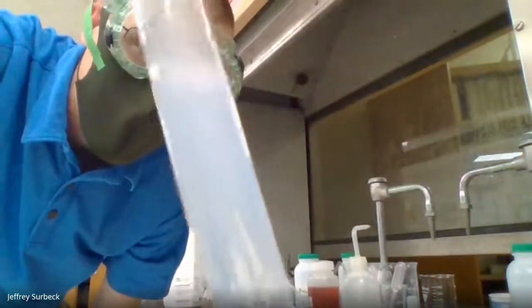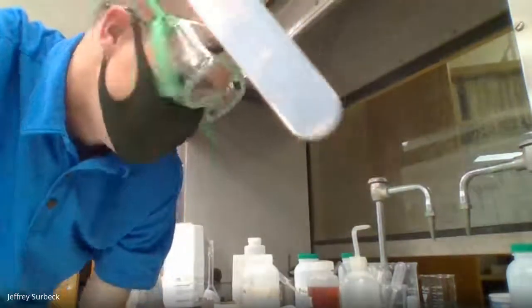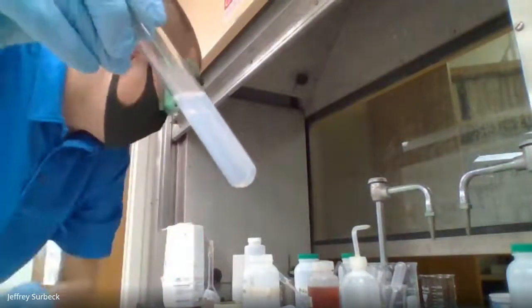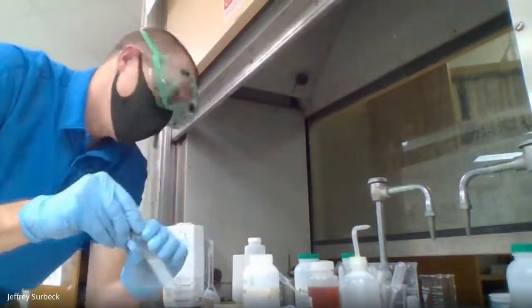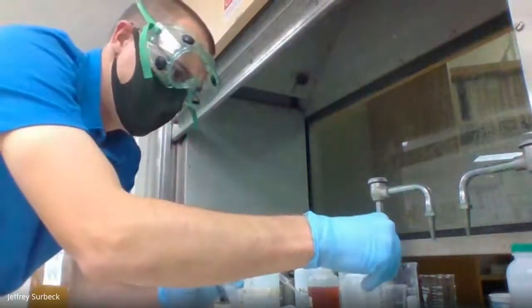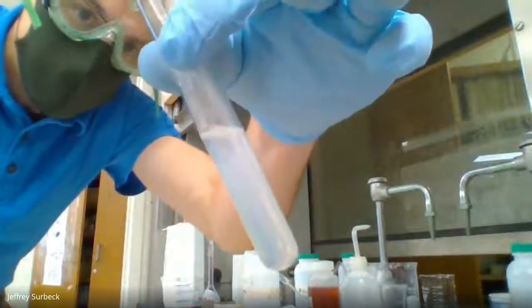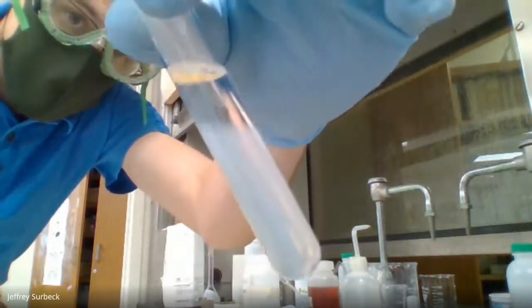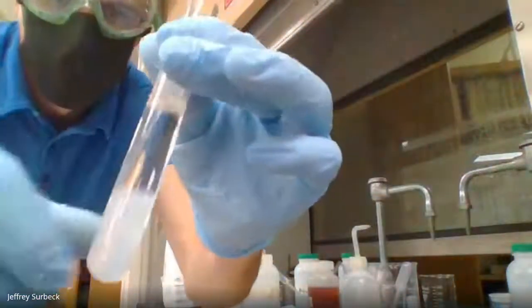Okay, so check this out. So now we've added the nitric acid. We're back to that cloudy solution. We have those precipitates in here. And one more time, this right here, what you see here should go under number 15. Now, for 16 here, I'm going to add our ammonium hydroxide, or our ammonium, until we observe a change. All right, so let me mix that up here.